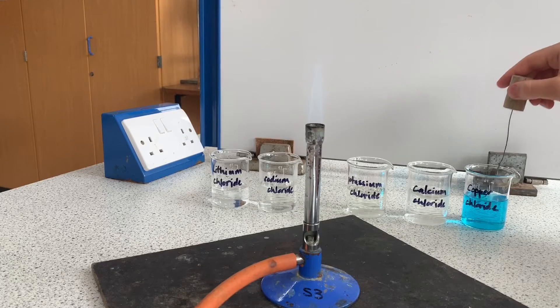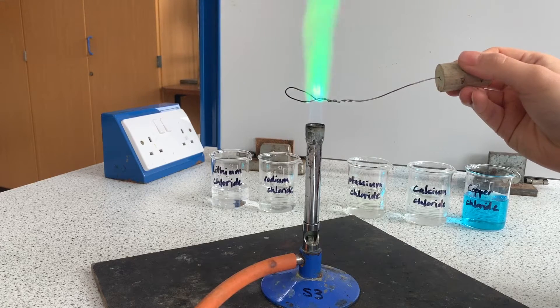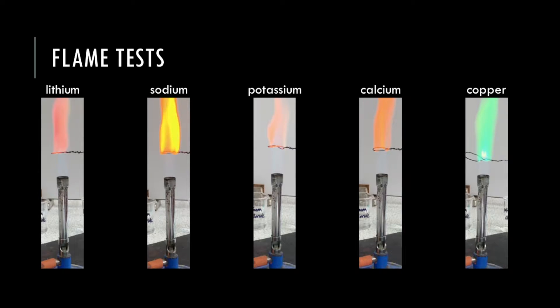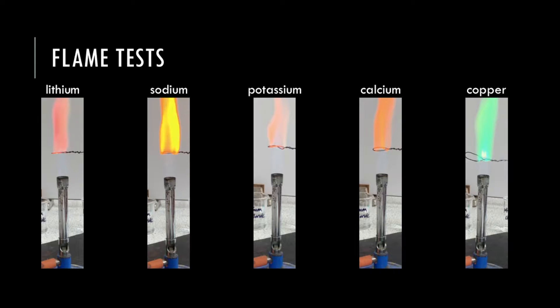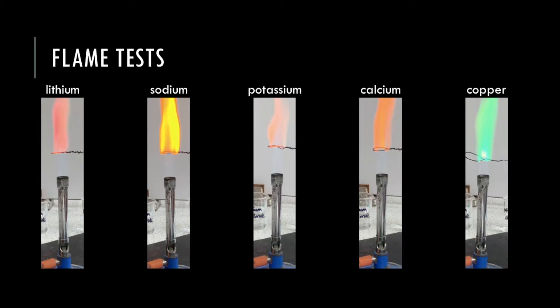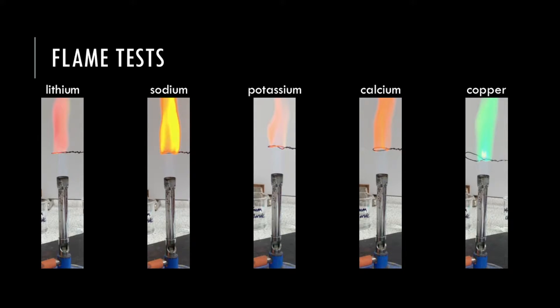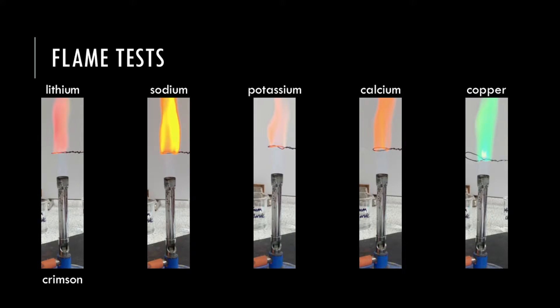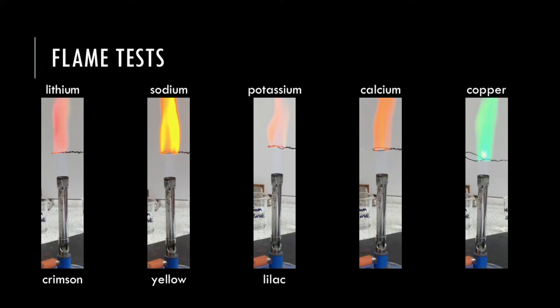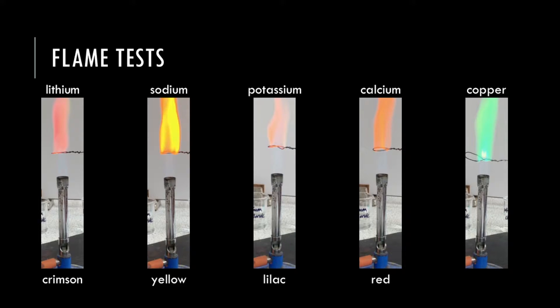Finally moving on to copper chloride and we can see that copper burns with the bright green color. I've taken photos of each of those flames so we can see them side by side with a dark background and hopefully the colors become a bit more clear, but to be honest it is quite difficult to see sometimes. You can see that lithium is the deepest red we have so that's the crimson one. The sodium flame is by far the most yellow in color. The potassium flame shows that faint faint lilac. Calcium gives us a dark orange flame that has hints of red at times and copper has this obvious green color.